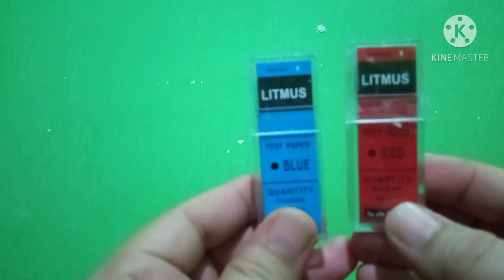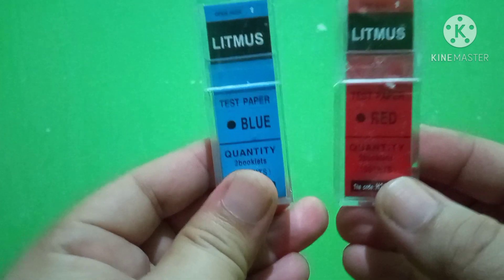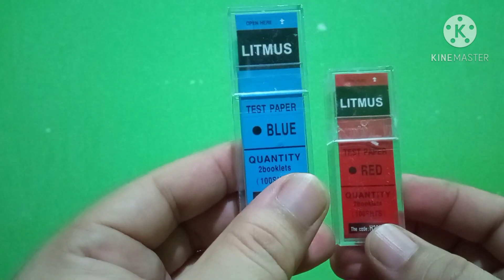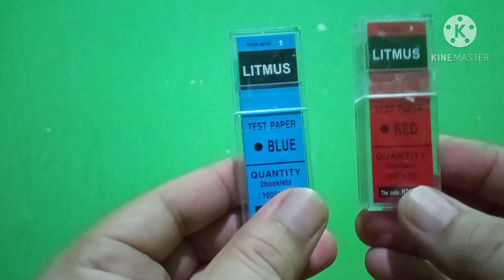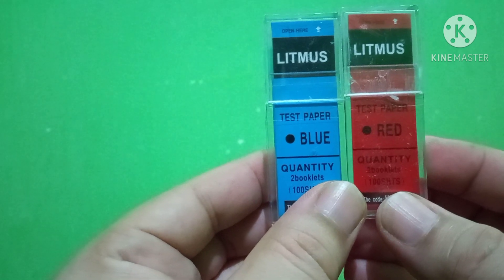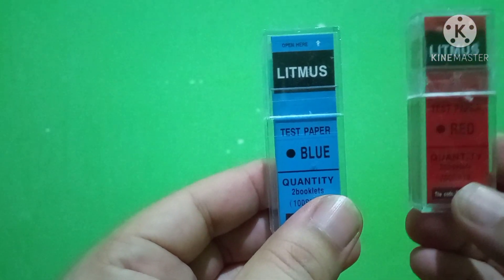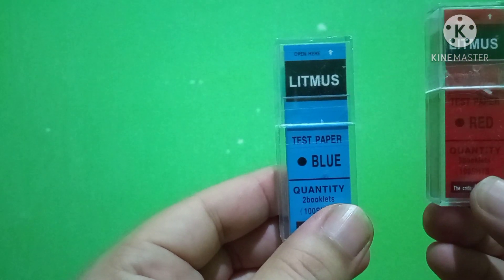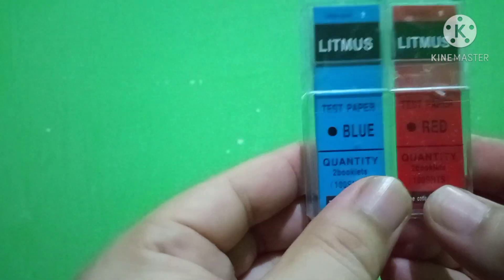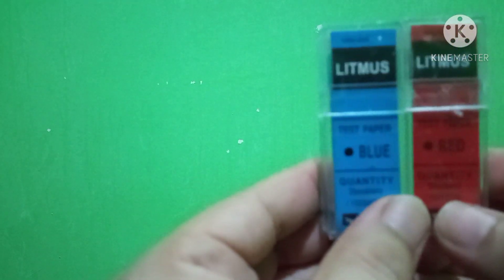For each solution, we will use two litmus papers together. If both are placed in an acid, the blue litmus paper will turn red, and the red litmus paper stays red — so if both become red, the substance is an acid. If the red litmus paper turns blue when placed in a basic solution, both become blue, meaning the solution is basic. I hope you get it.